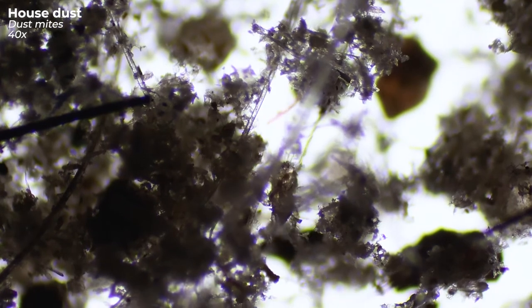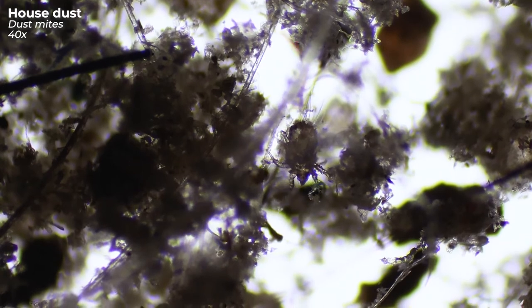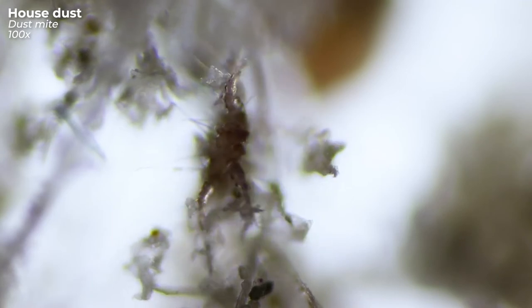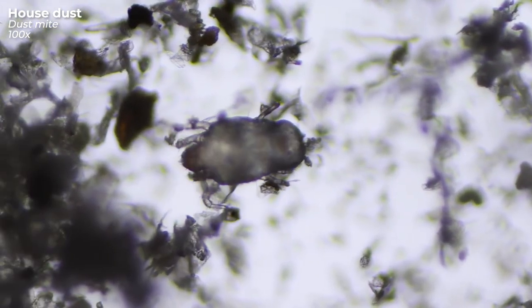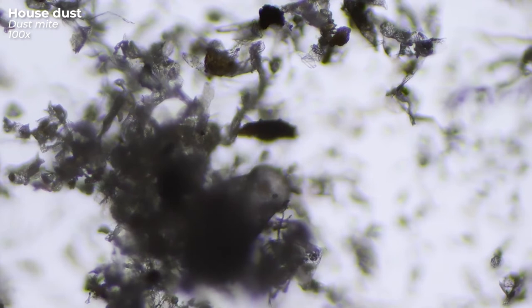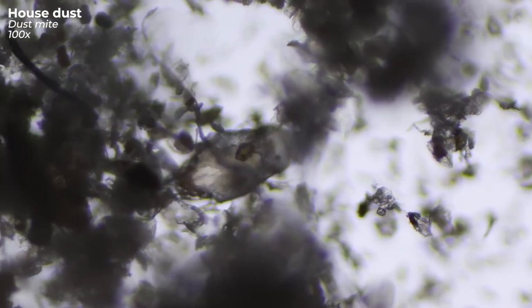And there it is — the crawling something that triggers the urge in me to set the whole apartment on fire. Meet the unwanted roommate: the dust mite. Preferably it lives in your bed, but you can actually find them everywhere and in every home. They might remind you a bit of a tick visually, and in fact they both belong to the class of arachnids — scorpions and harvestmen, or daddy longlegs, belong to this class too, because they also have four pairs of legs.